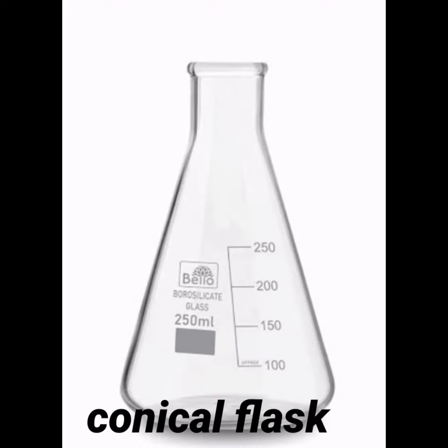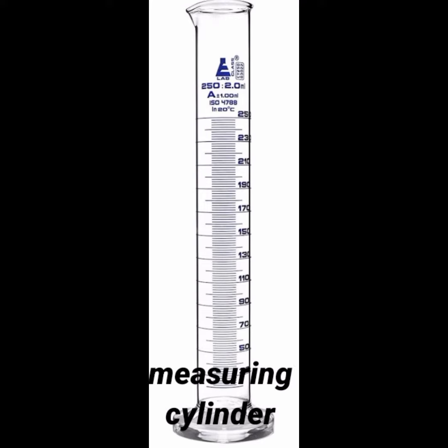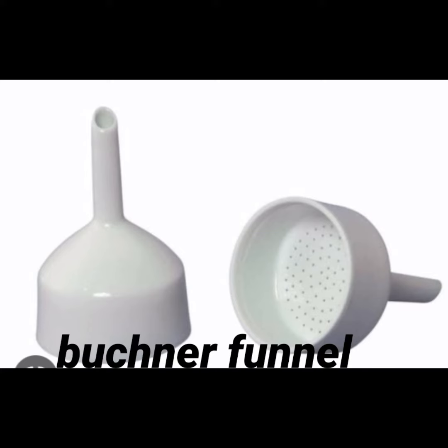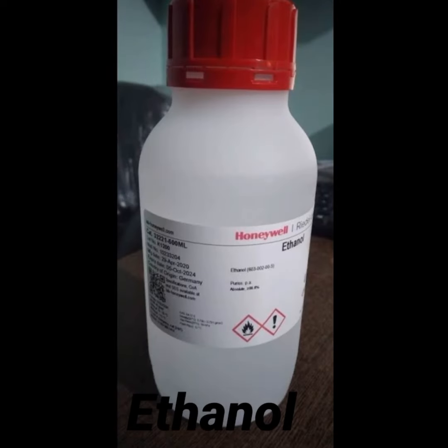Here we are going to prepare phenyl benzoate from phenol and benzoyl chloride. For the preparation of phenyl benzoate we need a 250 ml conical flask, volumetric flask, beaker, measuring cylinder, suction pump, Buchner funnel, phenol, benzoyl chloride, NaOH, and ethanol.